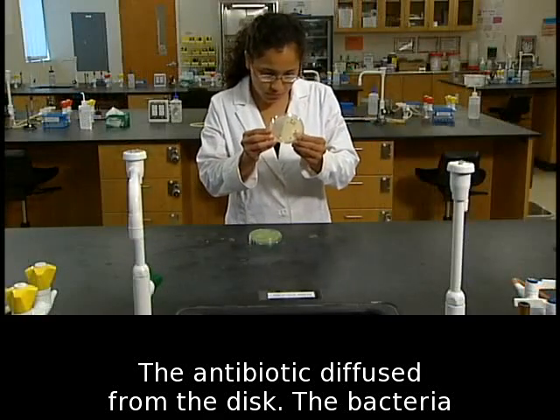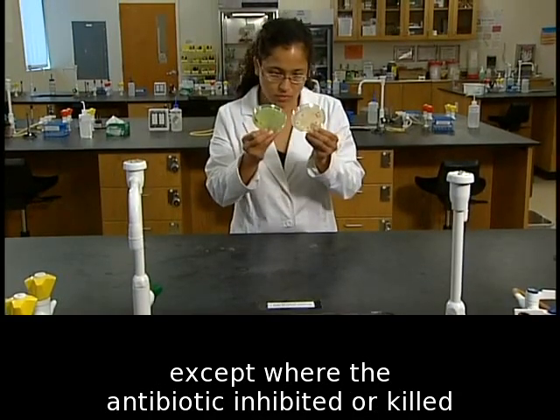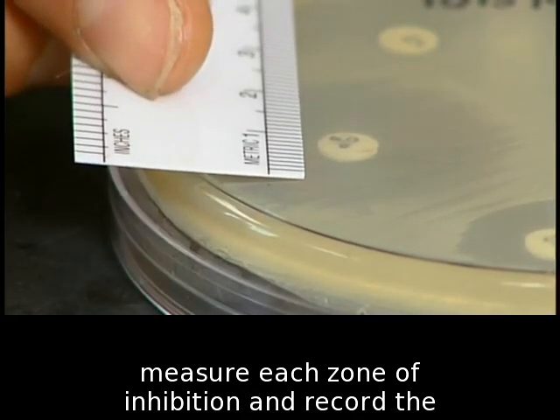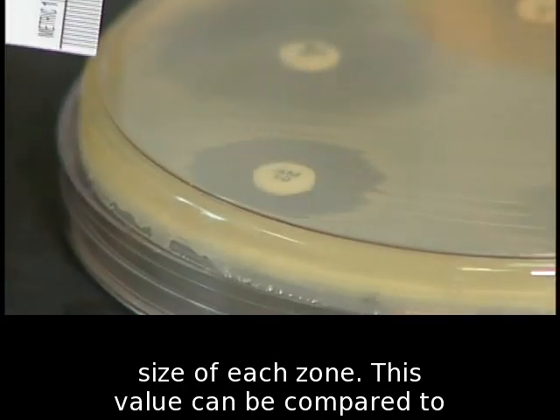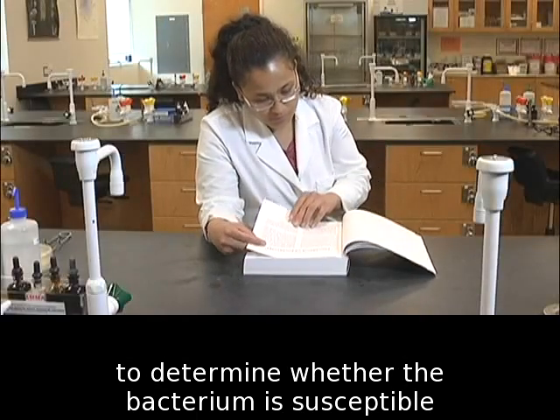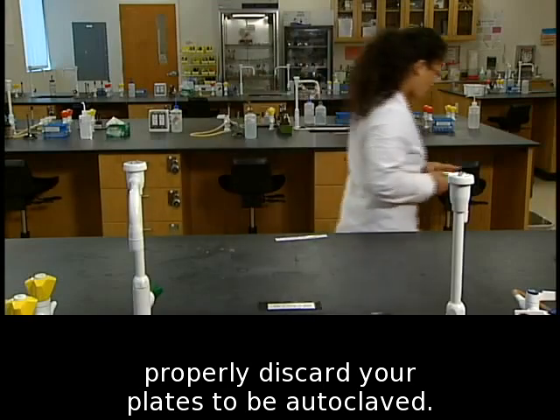The antibiotic diffuses from the disc. The bacteria should grow uniformly over the agar surface, except where the antibiotic inhibited or killed them. Using a ruler on the underside of the plate, measure each zone of inhibition and record the size of each zone. This value can be compared to the clinical and laboratory performance standards to determine whether the bacterium is susceptible to an antibiotic. After recording all of your data, properly discard your plates to be autoclaved.